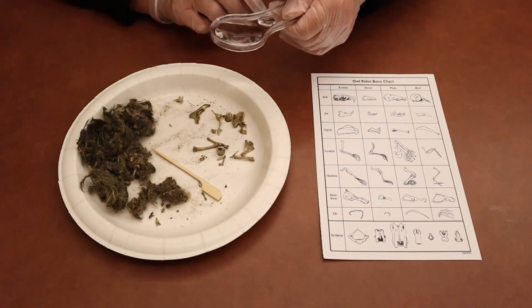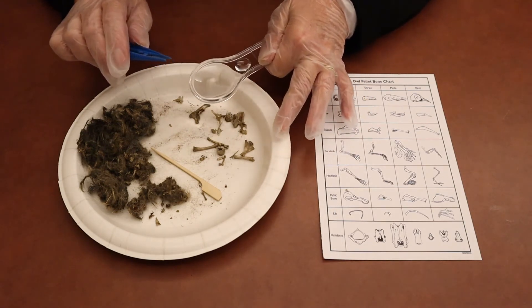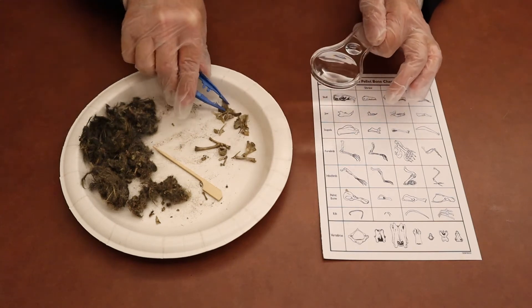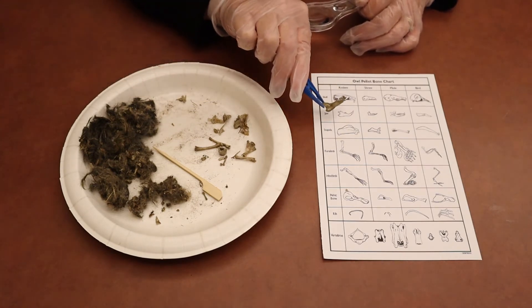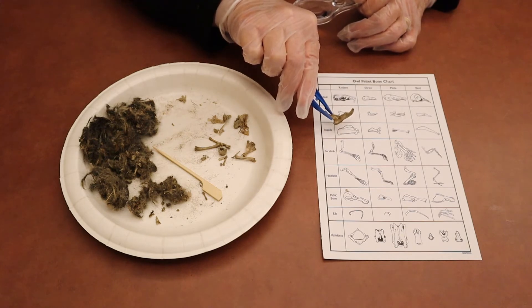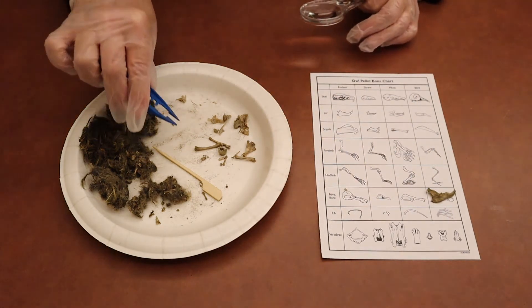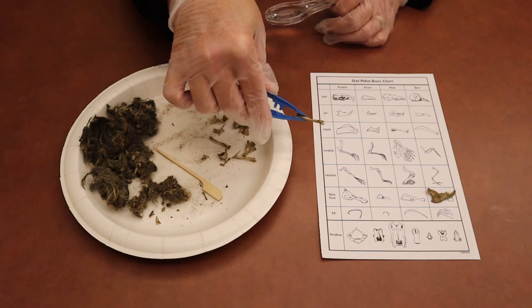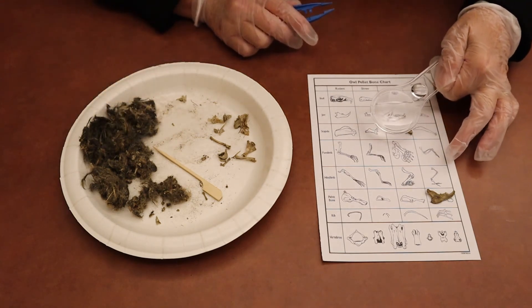The final step in our project is to take a closer look at the bones and see what kind of interesting things you can find in them. Then you can compare the bones to the different pictures on your chart. Using these tweezers it's kind of tricky holding onto things. This looks like maybe it might be a jaw, or it might be a scapula — I'm not really sure — or it might even be a pelvic bone. It's kind of big. Then there's leg bones — this one's a straight leg bone, or maybe an arm. You can compare on the chart as well.